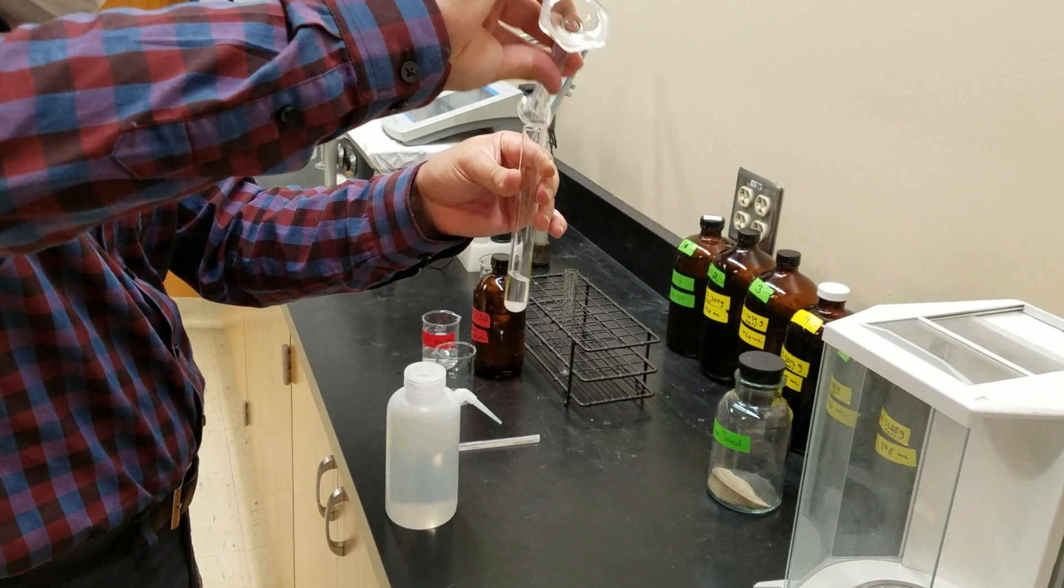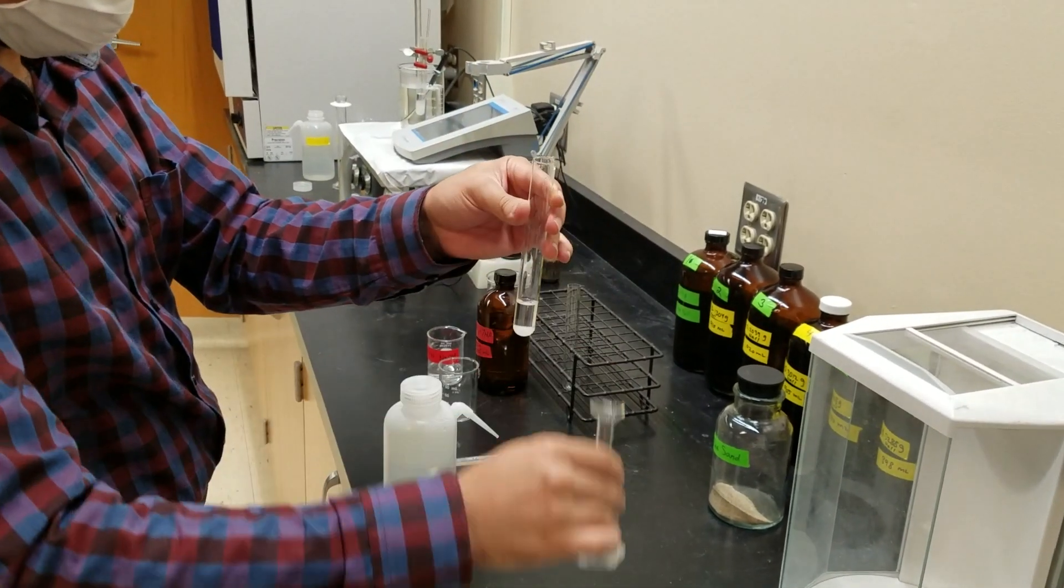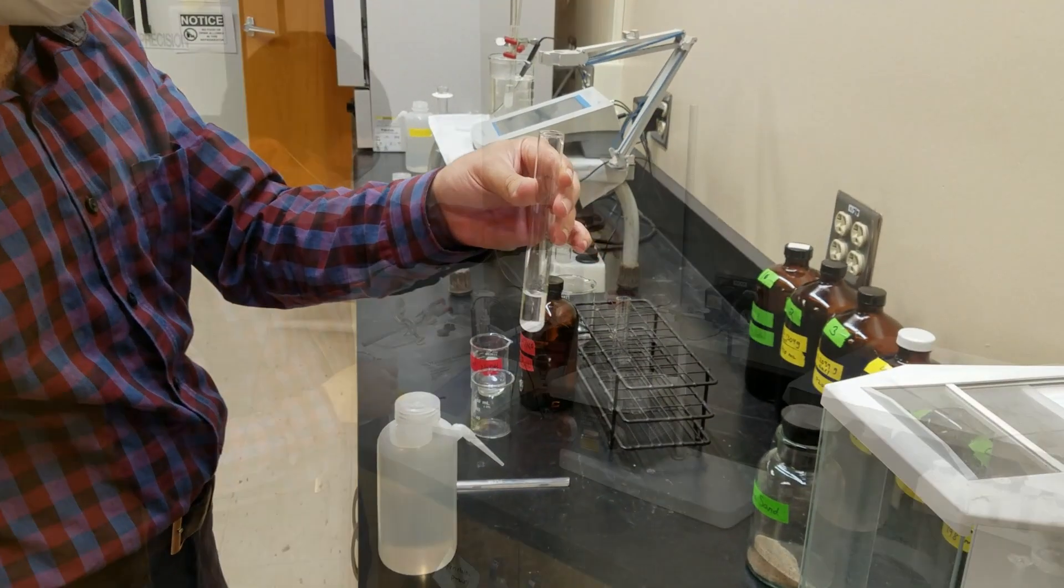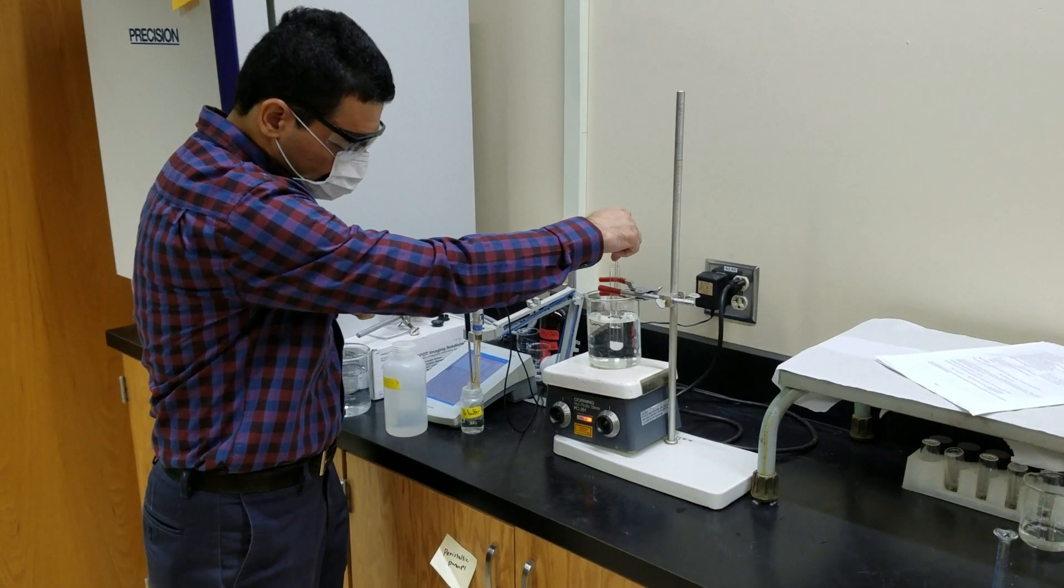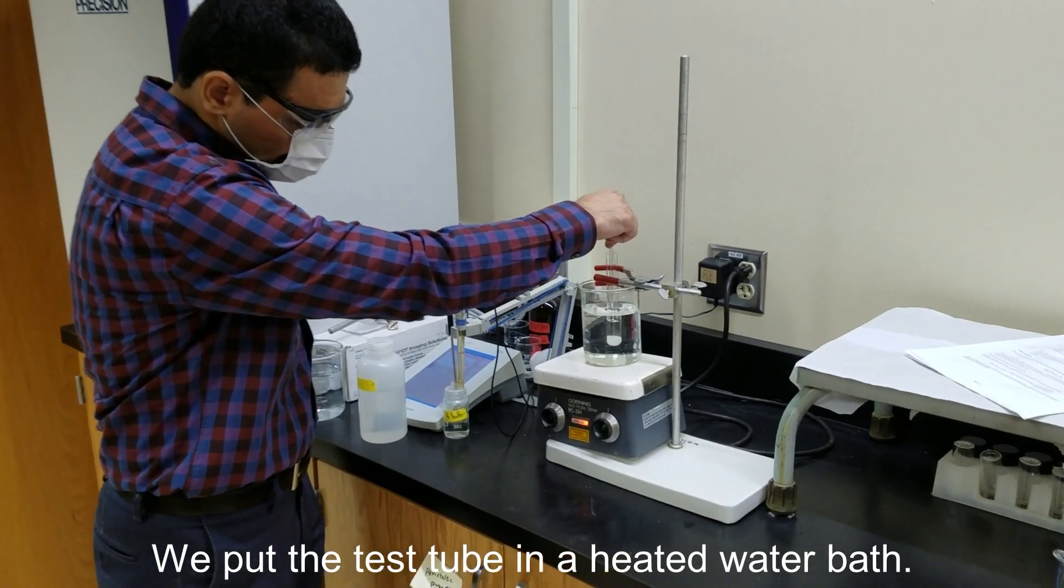Notice the potassium nitrate isn't dissolving all the way. That's because this water is too cool for all of that potassium nitrate to dissolve.